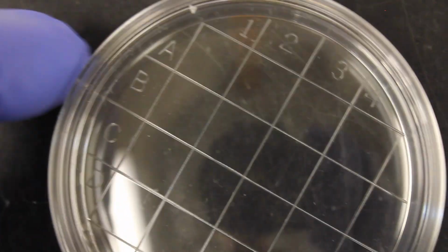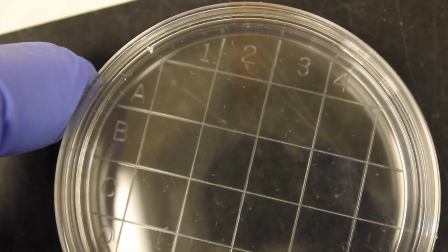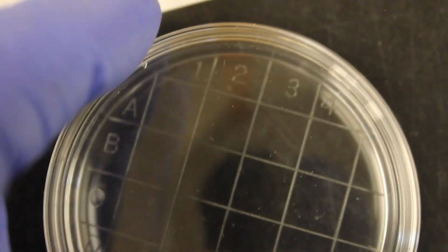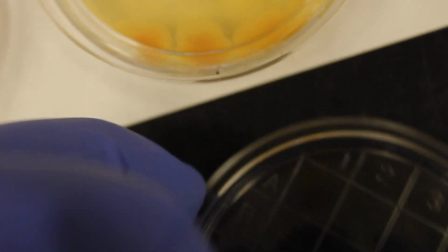Alright, what we're going to talk about are contact plates and how bacteria are ubiquitous. So here's a contact plate. This plate has a grid to help you count colonies if you're looking at quantifying it. Contact plates are special because they have a very small lip on the side. When you pour the agar in, the agar upraises on the top of this so that all you have to do with the agar is take this, place it down, lift it up, and you get bacteria.